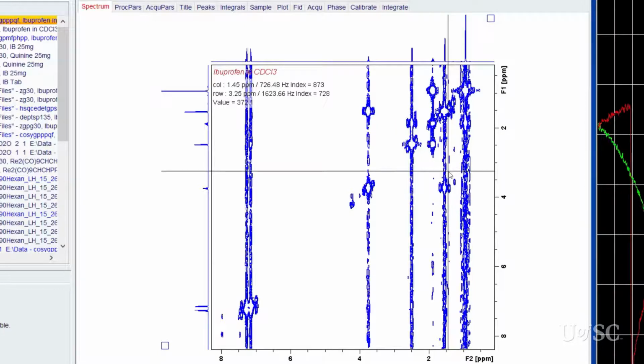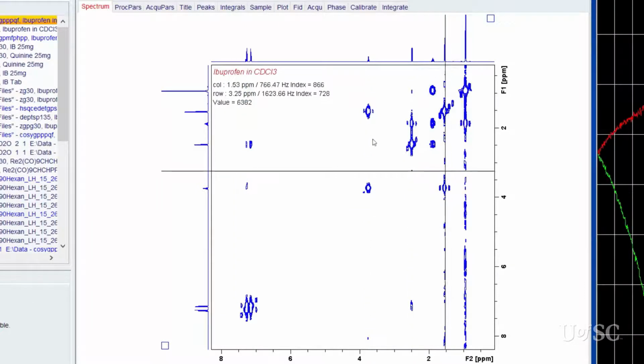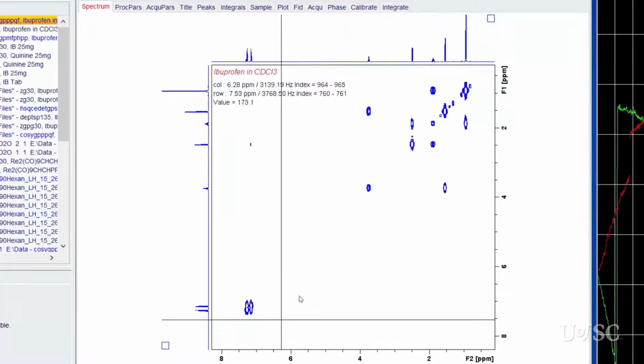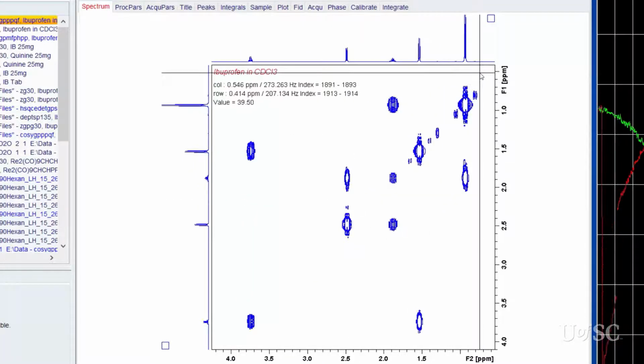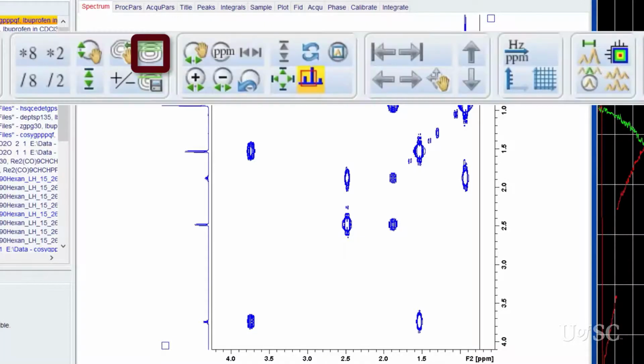In this and most cases, the noise is far below the weakest peak and can be brought below the lowest contour. Another issue we should address with the automation processing is that the number and spacing of the contours are not optimum. Notice the white spots on the larger peaks where the contours run out before they map the top of the peaks. This can be fixed with the Edit Contours button.